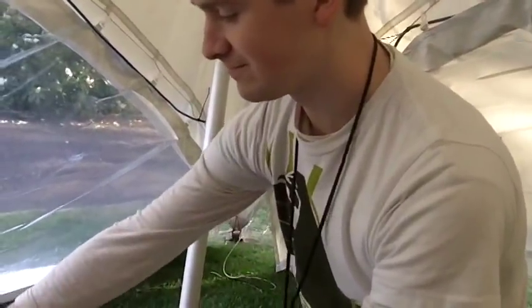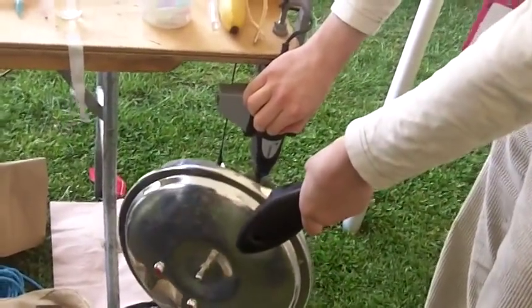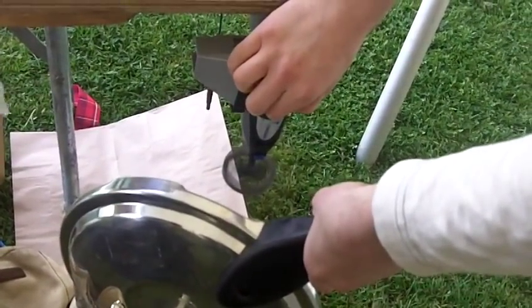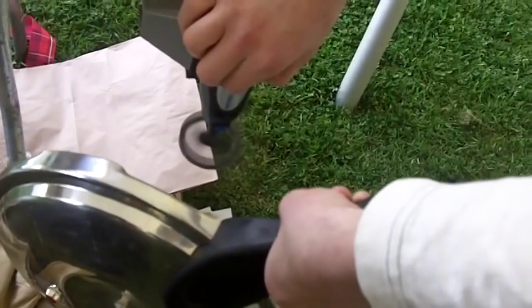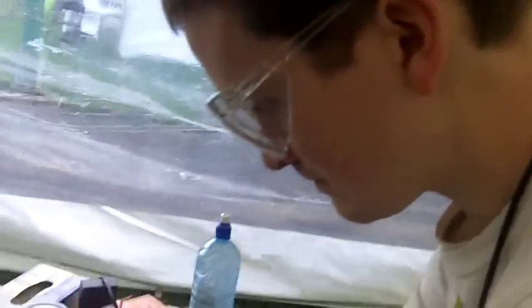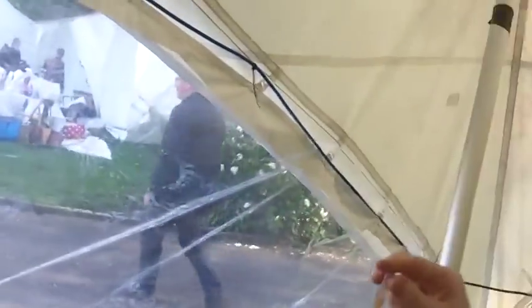When I'm on my own I wear goggles — safety first. I won't allow anyone else to be around either. Now that's going really fast — I'm cranking it up slowly. Now it's full speed. That is a hefty wind — the gods don't particularly like what we're doing, because some of the tents over there blew over.